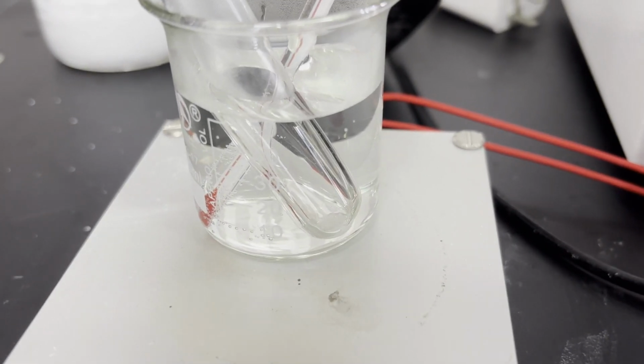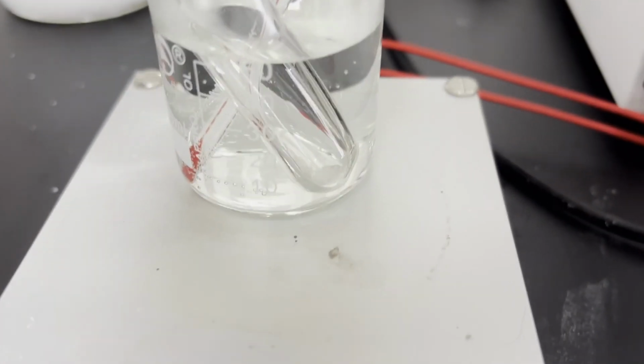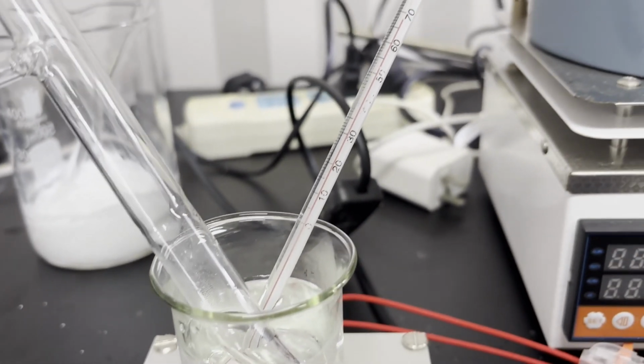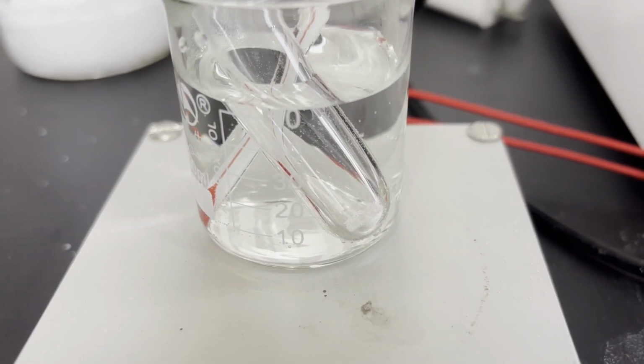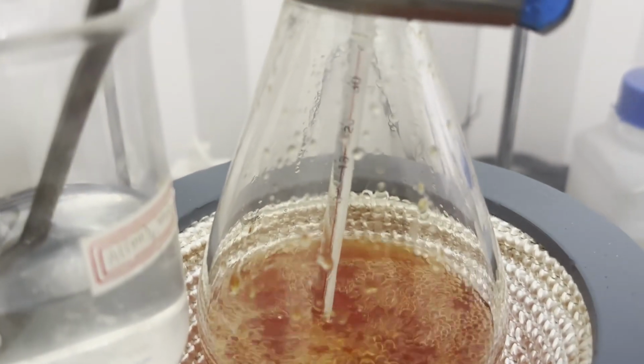I also performed a crude melting point test with some hot water, and only the pure sample of 4-bromophenol melted under 70 degrees C, while my samples did not melt. I highly suspect that my product was largely dibromophenol and tribromophenol, since I didn't control the amount of bromine. So yeah, this leaves us with a 0 yield.